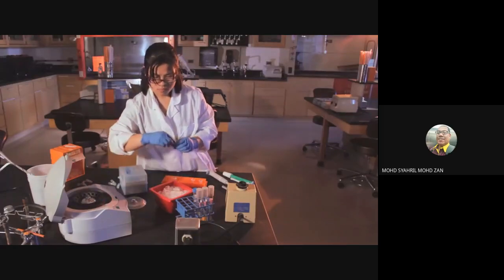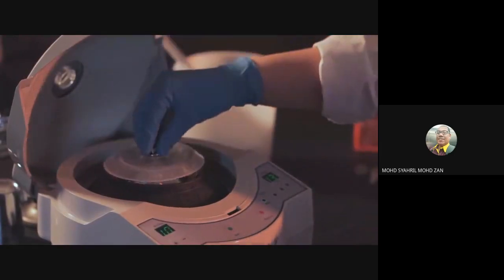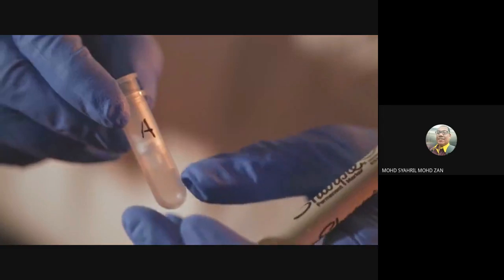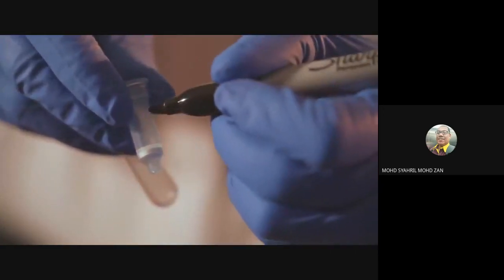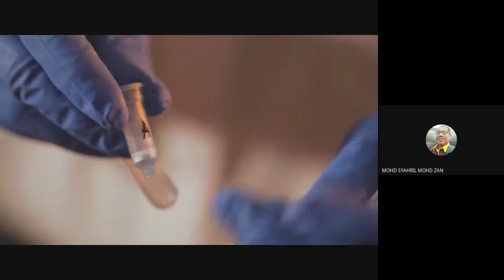Now close the tubes and centrifuge them for 10 minutes at full speed. Remember to balance your centrifuge. While your samples are centrifuging, label one spin column for each culture you started with. Each spin column consists of the column set inside an empty collecting tube. Label both the collecting tube and the spin column.